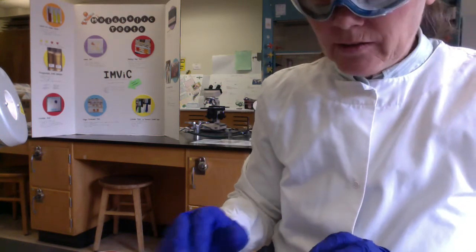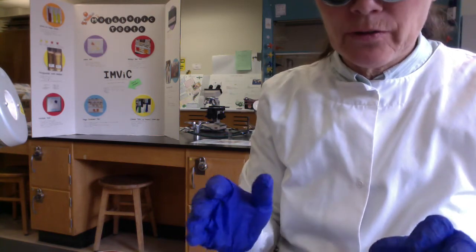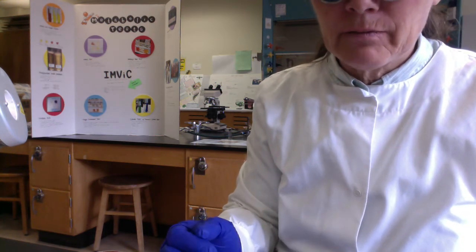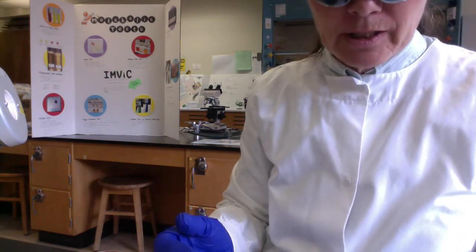So folks, you'll recall that we said that blood agar is enrichment so that we can grow fastidious bacterial pathogens, supplying all their growth factors. So usually in diagnostic labs, a sample coming in from a human patient, if a bacterial pathogen is suspected, you're always going to streak to or inoculate blood agar.